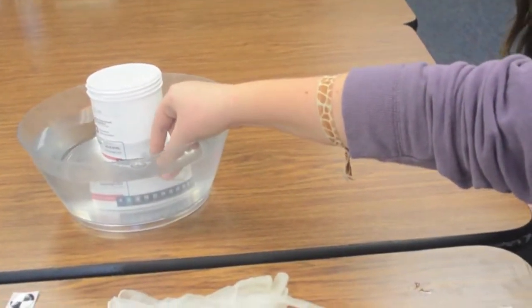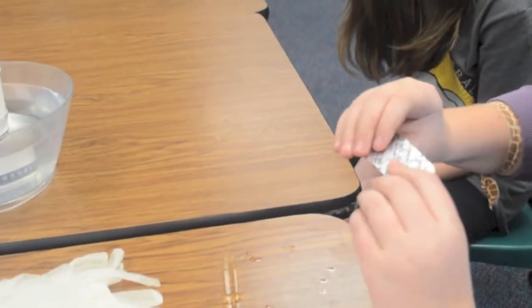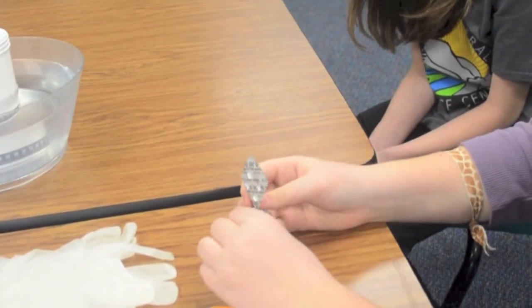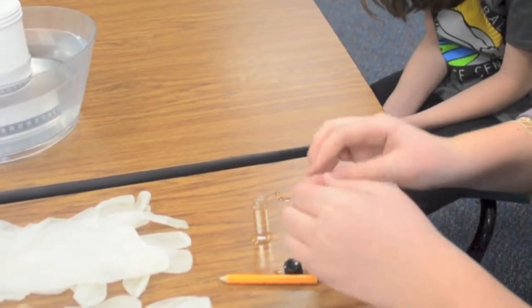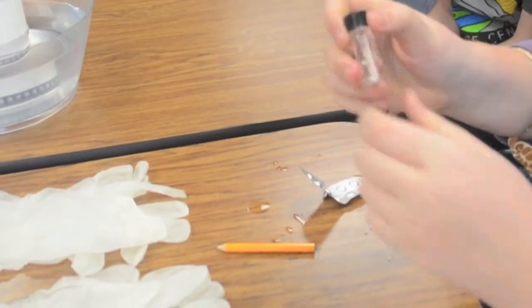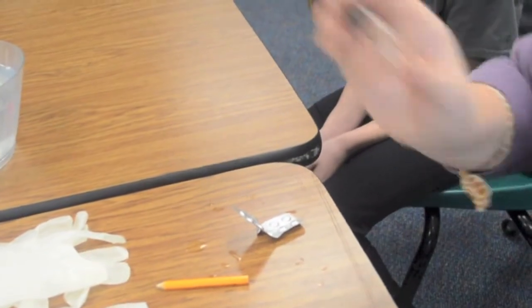Put the small vial into the water and make sure it's filled to the brim. There may be a little bubble on the top. Drop 2 DO tablets in the vial. Just to let you know, it will overflow. Screw the lid on very tight. Make sure there are no bubbles. And then you can shake it until the tablets dissolve, around 4 minutes.